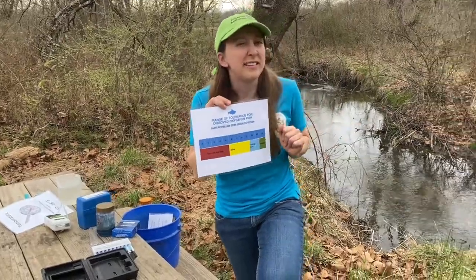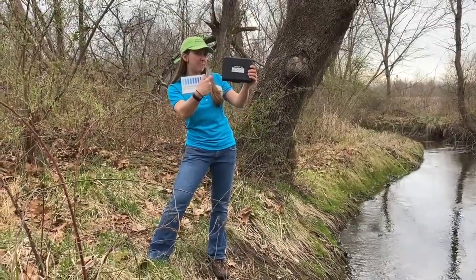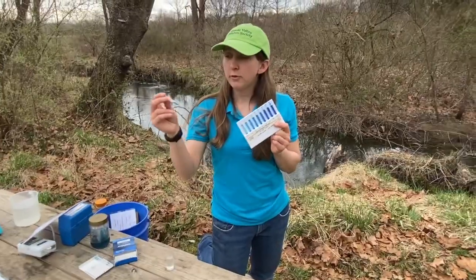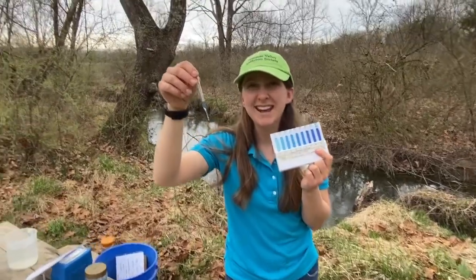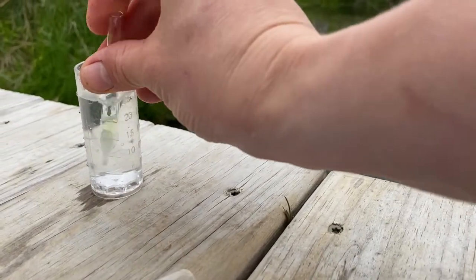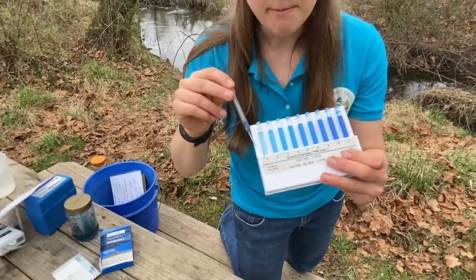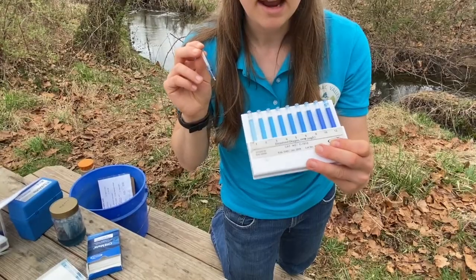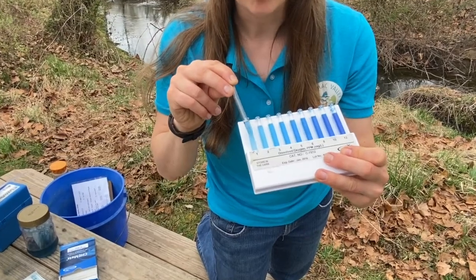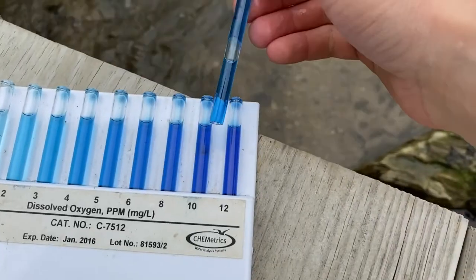We're going to test the dissolved oxygen levels of Bullskin Run. I have my handy dandy dissolved oxygen testing kit. This is called an ampule — it has a chemical inside that will change colors when the tip breaks and it is inserted in a container of water. It sucks up the water and changes a color that matches one of these other ampules already tested at different dissolved oxygen levels. This light color is a dissolved oxygen level of 1, whereas this darker color is a dissolved oxygen of 12.